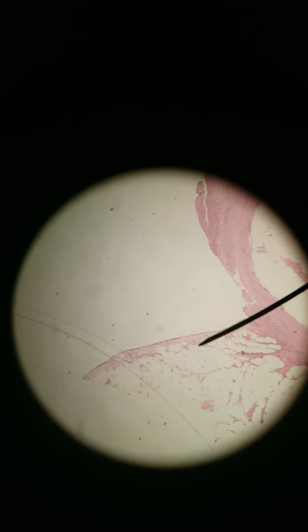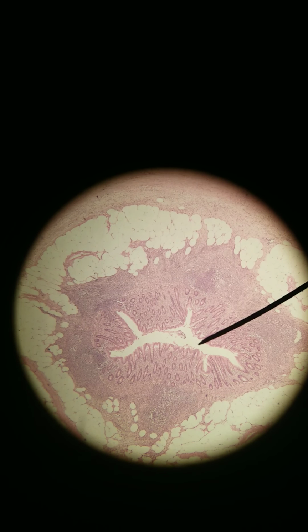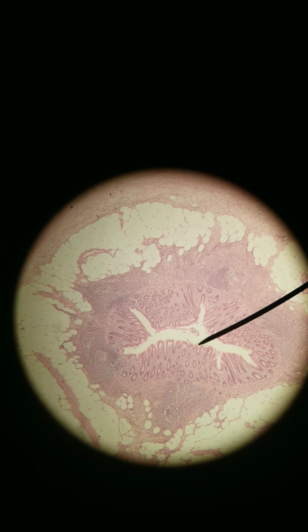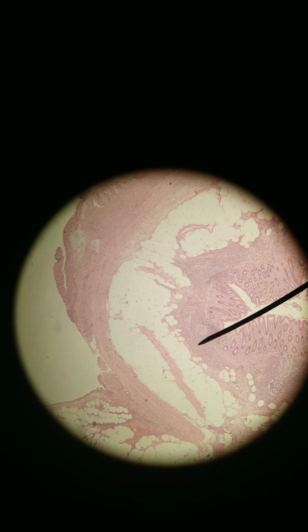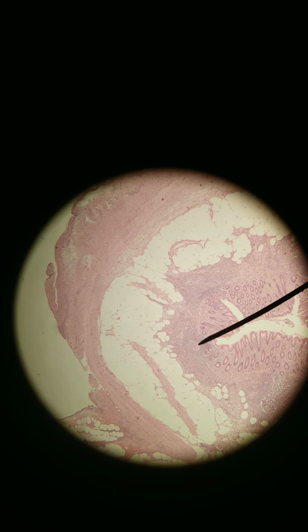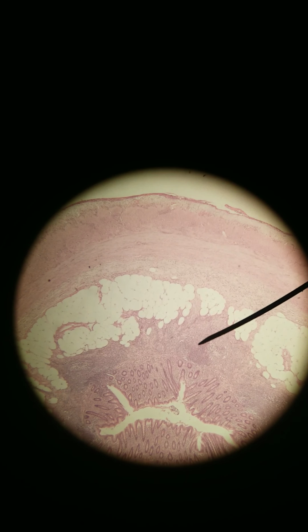When we get into the cecum, we could go up to the ascending colon. We could actually go a different way, kind of a dead end though, to the appendix. This is the appendix. Very small lumen here in the center. We're at 40x. Has crypts too. Those are crypts. And then has lots of lymphoid follicles. Here's one here, another one here, another one here.